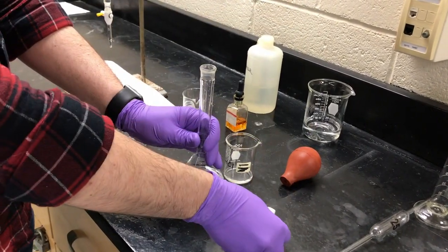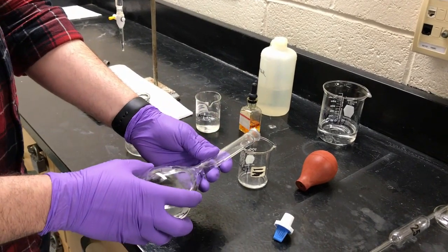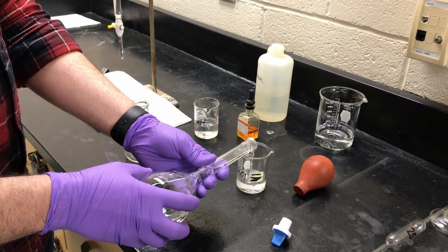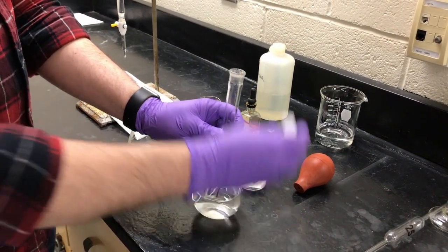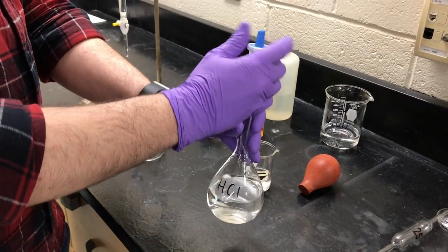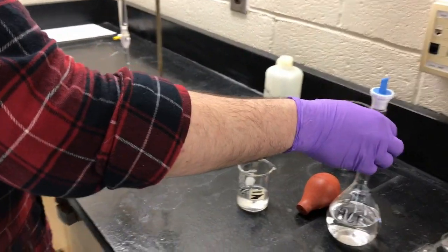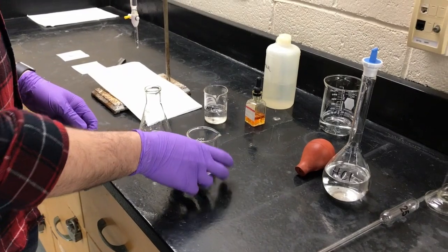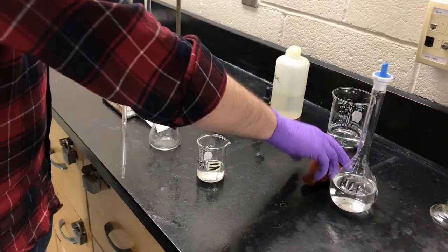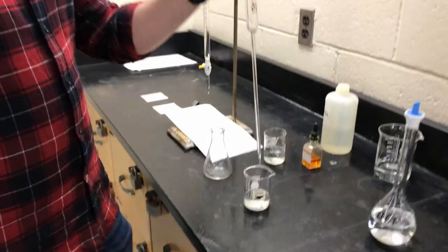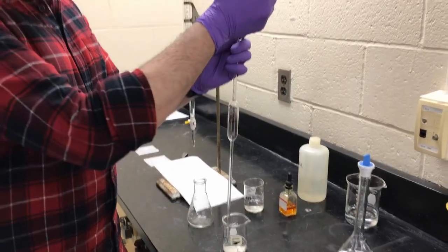So we have this kind of our stock solution, I guess the dilute stock solution. And I'm just going to pour this into this smaller beaker over here. This is the 0.6 molar. And using this volumetric pipette as before, I'm going to get exactly 25 milliliters.